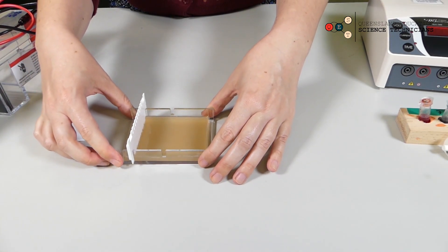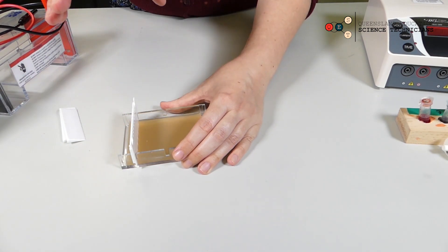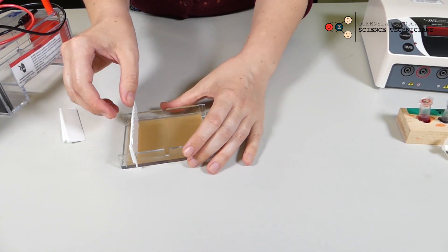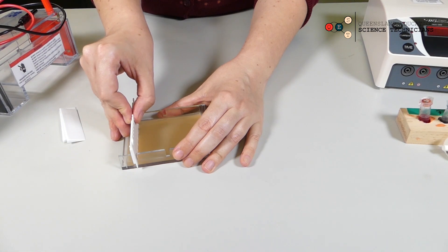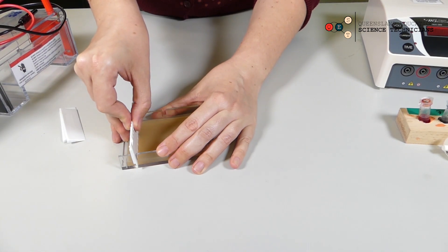And the comb. Same idea. We're very careful not to break the agar or introduce cracks into the agar. So just a really gentle little wiggle and then pull it straight up and out.